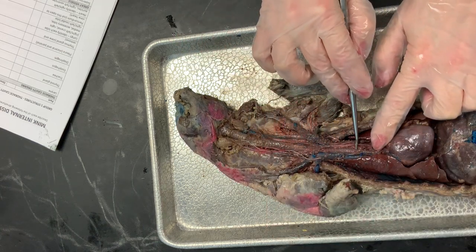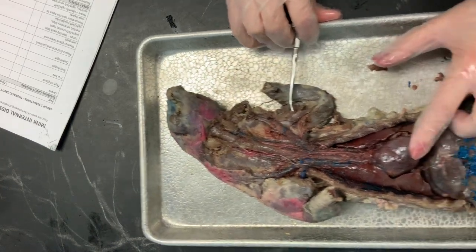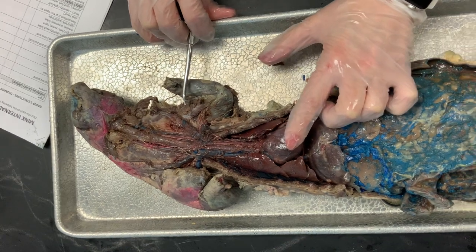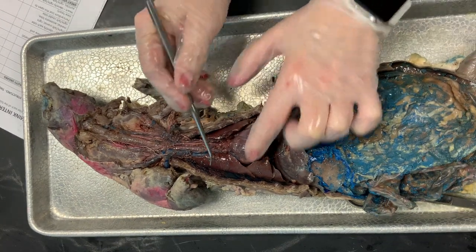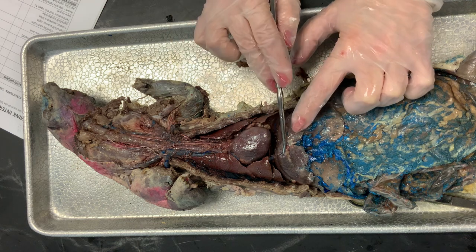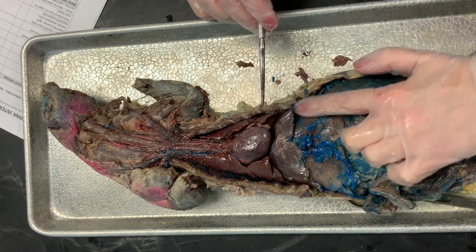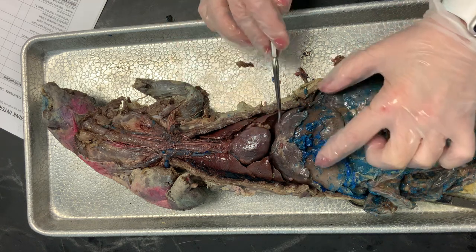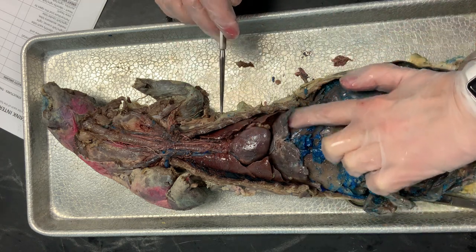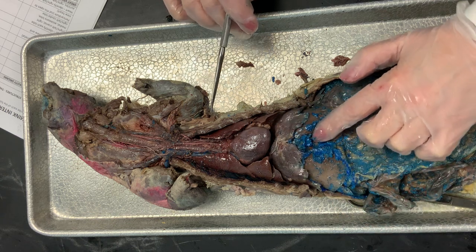As we follow the trachea down, we're going to encounter the lungs, the heart, and then the diaphragm. This structure right here is the diaphragm — I have cut it away from the abdominal cavity wall, so it's just this arched-shaped muscle that sits on top of the liver.